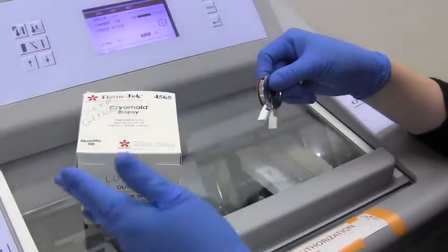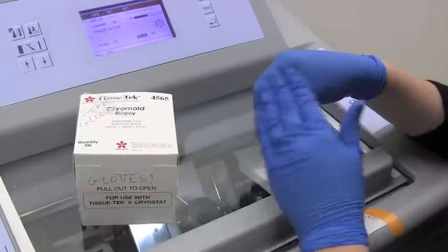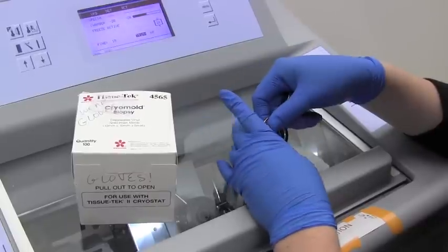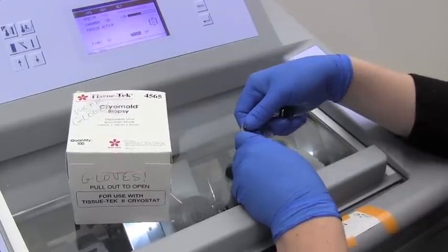This allows you to process a lot of samples at one time, freeze them on dry ice, and then just store them in the minus 80 until you're ready to use them and ready to cut.